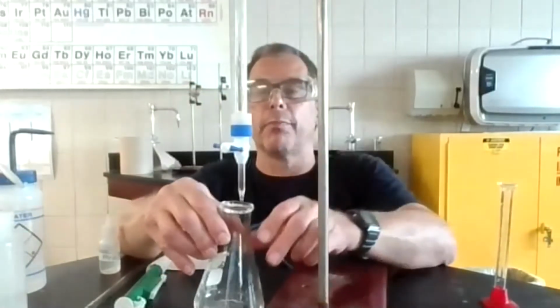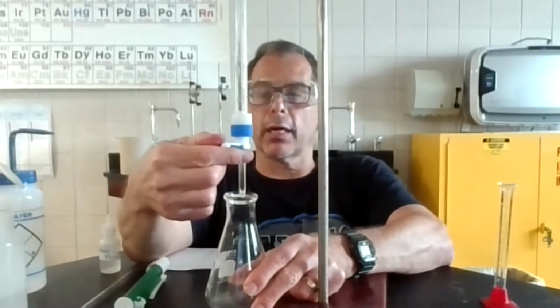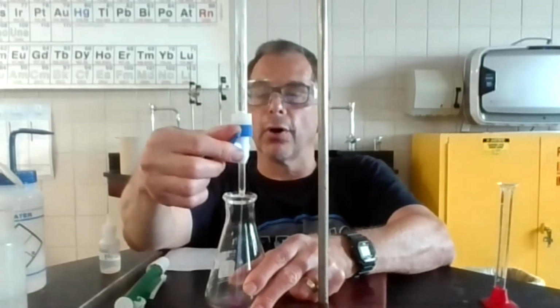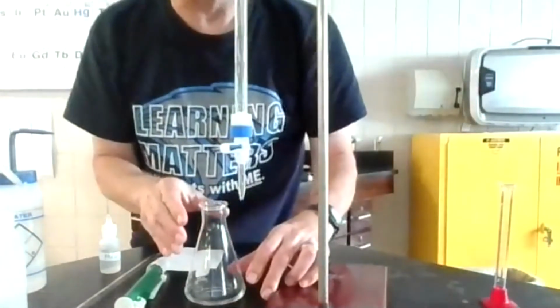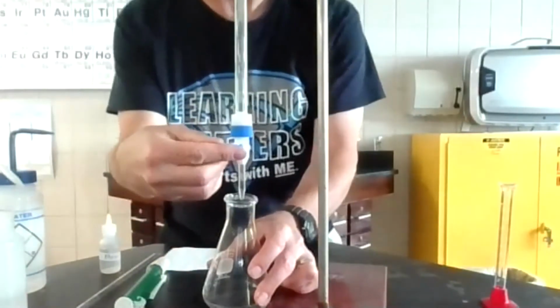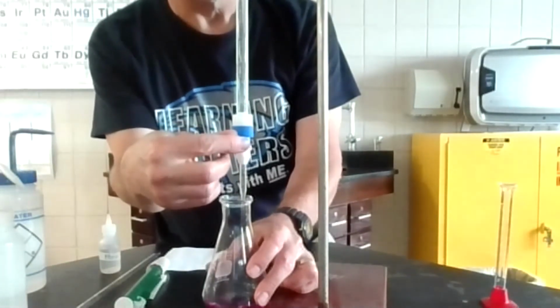And now I'm going to drop the base, and now I know I should be able to run out 5 milliliters pretty quick because I know it's going to be between 5 and 15. If you overshoot though, what happens is, you know, for the next time. So I'm not too worried about the first trial. You got multiple trials. You could use the first one to get a range, but I'm going to try to do this one right here because I'm running out of time for this video, and hopefully I can kind of nail it because I just want to do that.